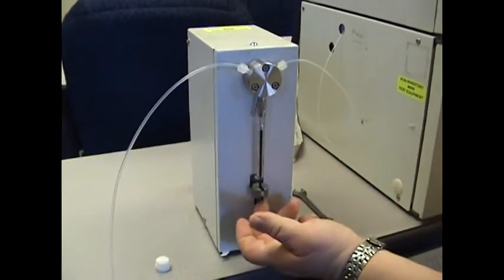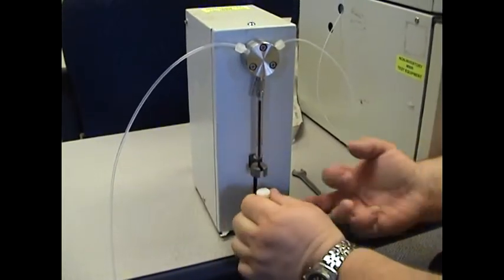And finally, don't forget the white nut for the bottom to hold the plunger in place.